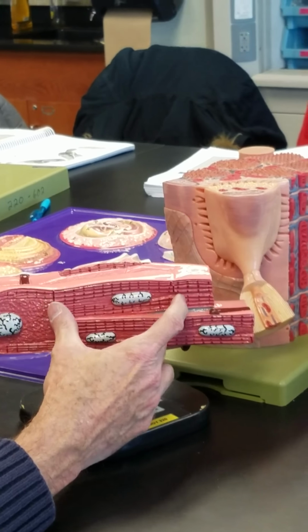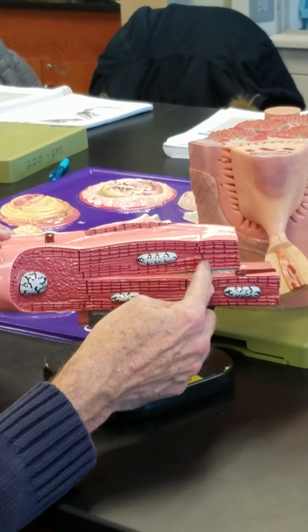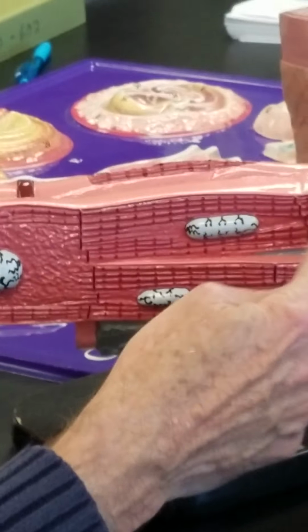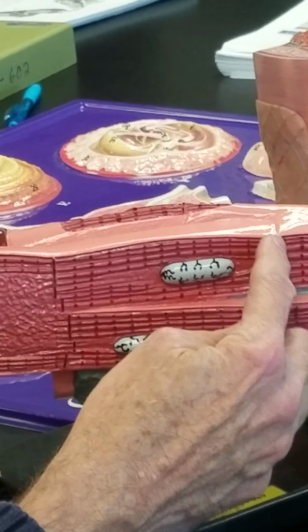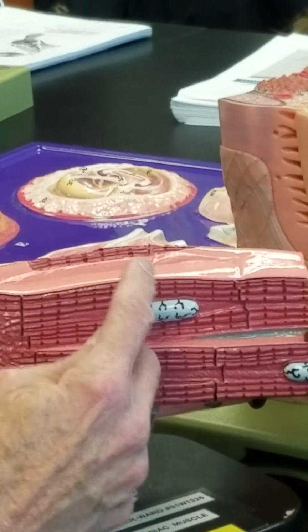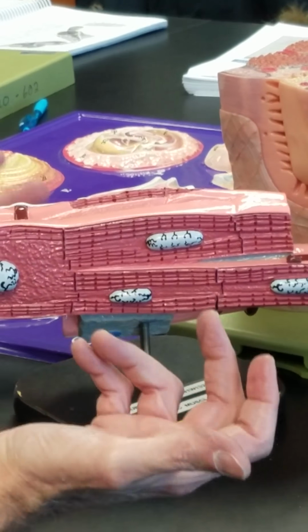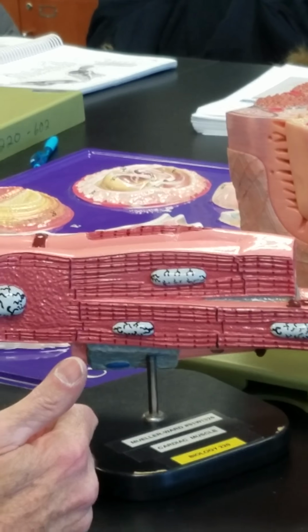So this is one cardiac muscle cell. It ends in an intercalated disc here on the left, and it ends in an intercalated disc here on the right. That's another, the neighbor. It's a separate cell. But the gap junction linkages here make them function as if they are one cell. Because if we trigger an action potential here, it would spread through to the next cell and trigger contraction of that cell also. We contract as a group. Functional syncytium. We talked about it earlier.